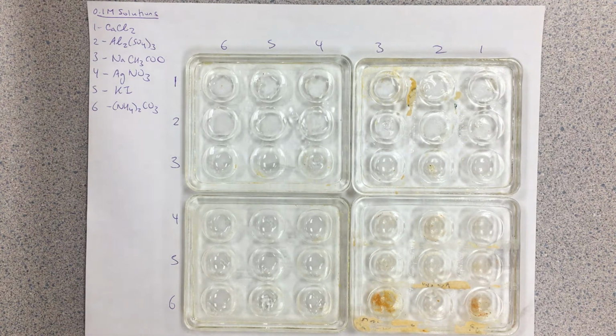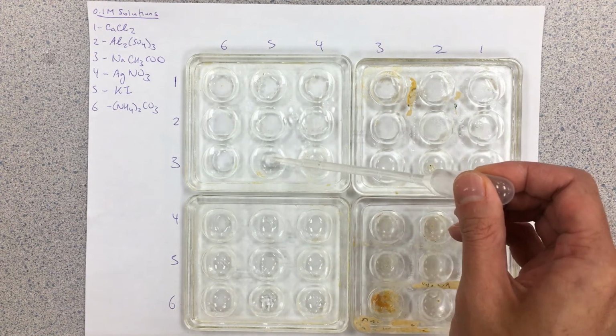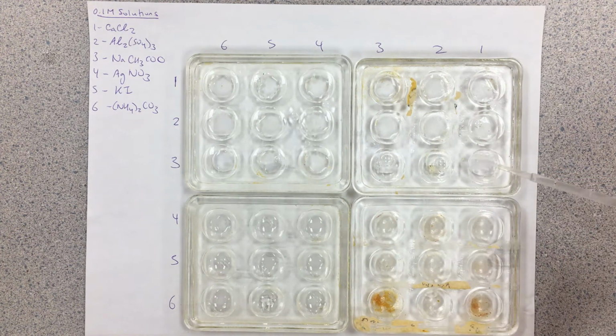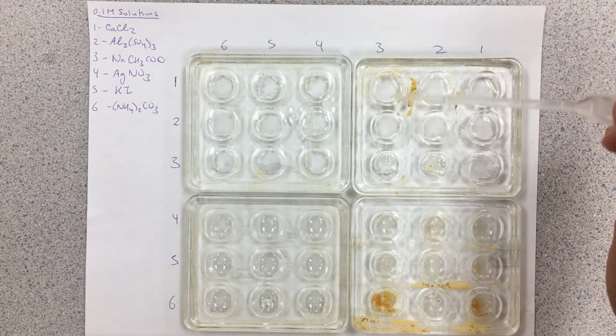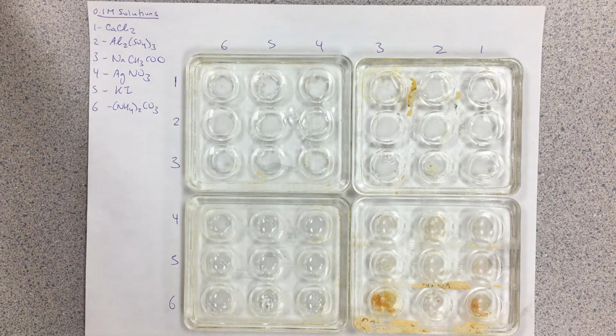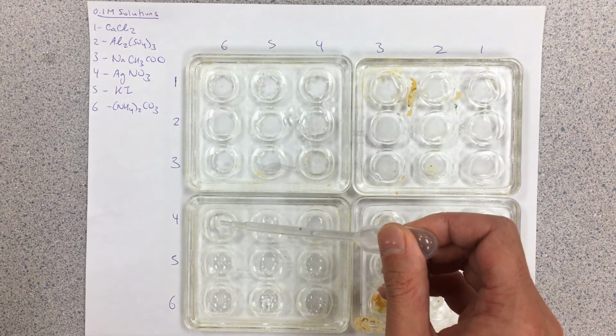We're going to continue on with solution number 3. This one here is sodium acetate. Sometimes when we do this lab, we actually start changing the solutions just to introduce different ions that potentially form. So for the solutions I have listed for you here, we can match it up with the solubility table later on and see whether the precipitates actually formed in the combinations that we're doing here. In any case that there's some discrepancy, you're going to see if you can make some discussion of why that is. So solution number 4 here.